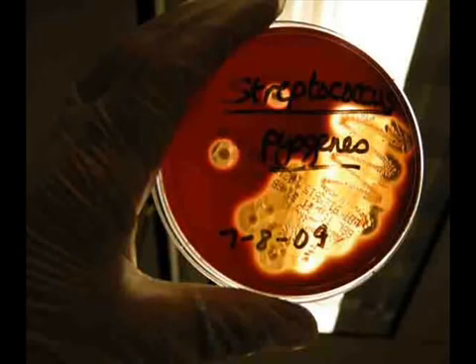There are several different kinds of bacteria that can cause beta hemolysis, but we've taken a throat sample, so what we're looking for is Streptococcus pyogenes, a pathogen that is beta hemolytic. So when we see a beta hemolytic pattern on blood agar, we need to look at the colony morphology of the bacteria growing there. Streptococcus pyogenes will grow in punctiform, small, circular, creamy white colonies on the blood agar, whereas gram-negative organisms that are beta hemolytic will grow in larger, grayish and tannish colonies.